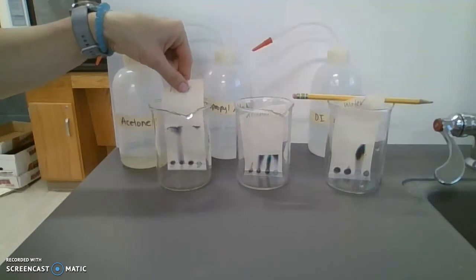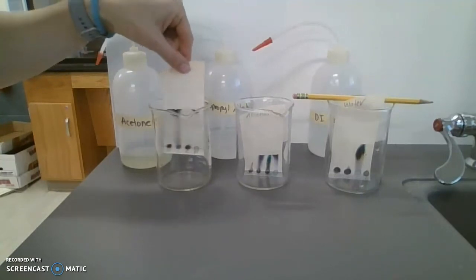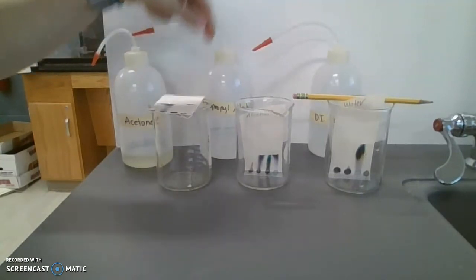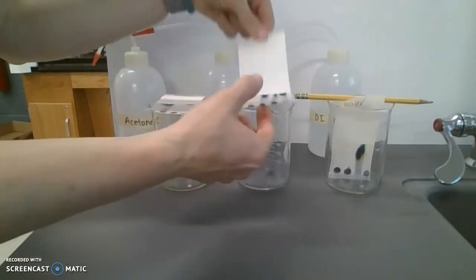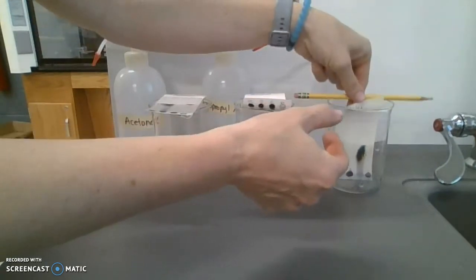So now what we can do is we can remove our filter papers so that they can dry. All right, lay them across the top like so.